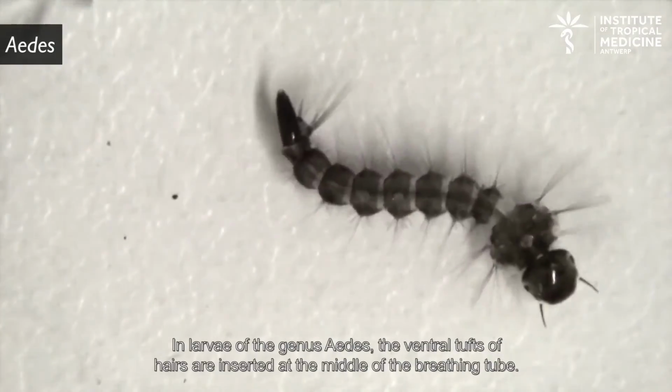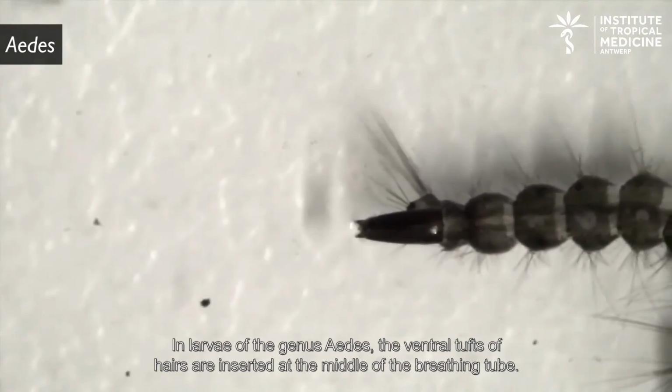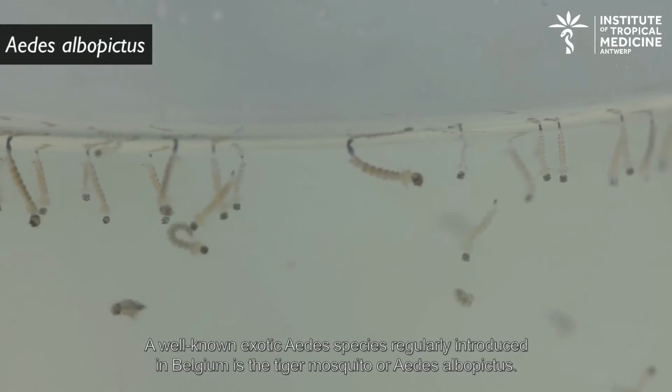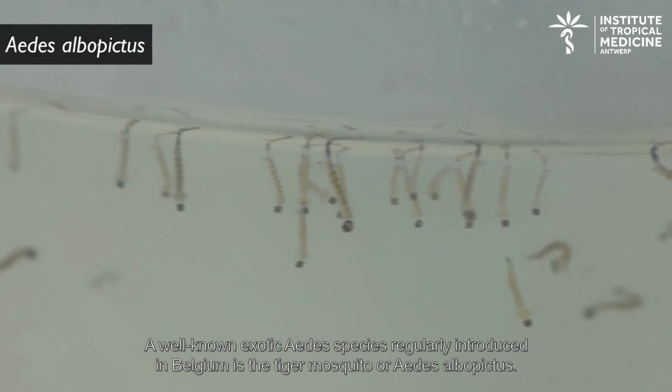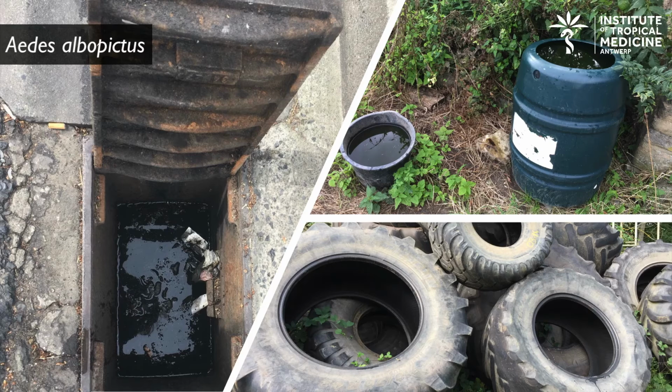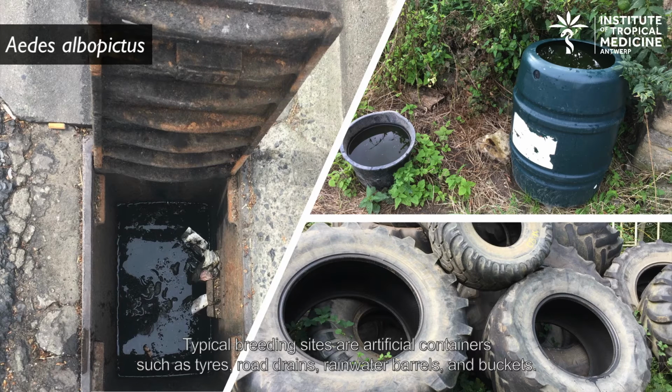In larvae of the genus Aedes, the ventral tufts of hair are inserted at the middle of the breathing tube. A well-known exotic Aedes species regularly introduced in Belgium is the tiger mosquito or Aedes albopictus. Typical breeding sites are artificial containers such as tires, road drains, rainwater barrels and buckets.